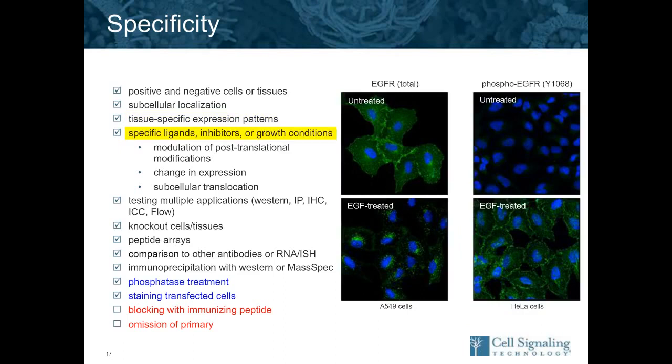For signaling antibodies specifically, we look at different inhibitors and ligands, ways to stimulate the pathways. So in the two pictures on the left, this is an EGFR antibody, a total antibody, and you can see where EGFR is in the top left picture in untreated cells. And when we treat the cells with EGF, now you see that receptor has been internalized. Looking at the two pictures on the right, this is now a phospho antibody. So you see there's no green stain in the top. And when we treat with EGF, we see phospho-EGFR turned on. Note that these weren't the same time. The one on the right is a shorter time period.